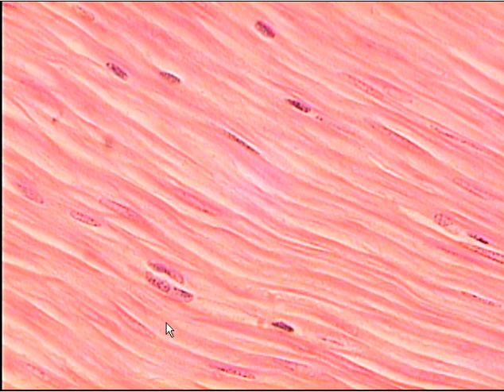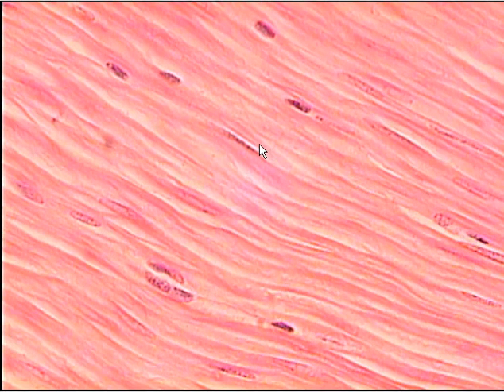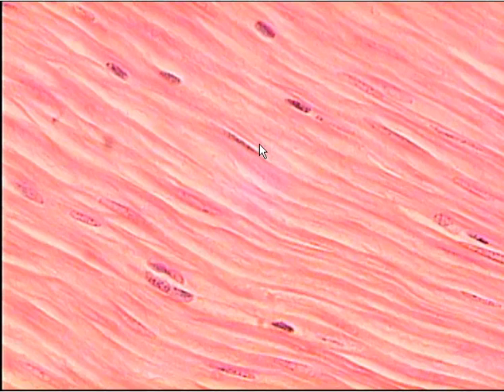The structures are basically there's only the nucleus. As you can see, it's right here. It looks a lot like skeletal muscle, but what you have to remember is that smooth muscle is not striated.